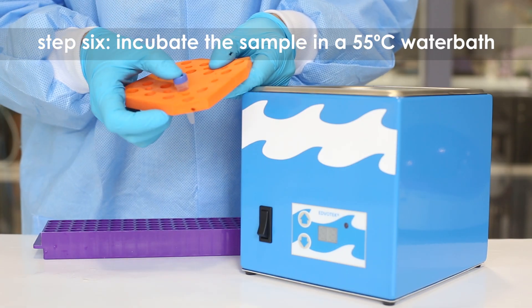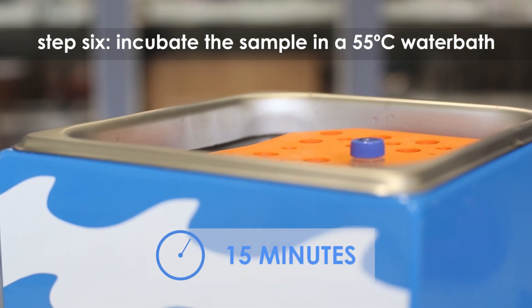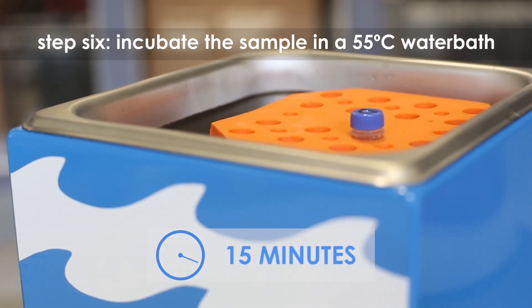Step 6: Cap the tube and place it in a water bath float. Incubate the sample in a 55 degrees celsius water bath for 15 minutes.